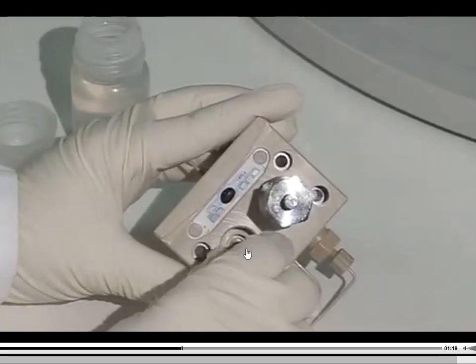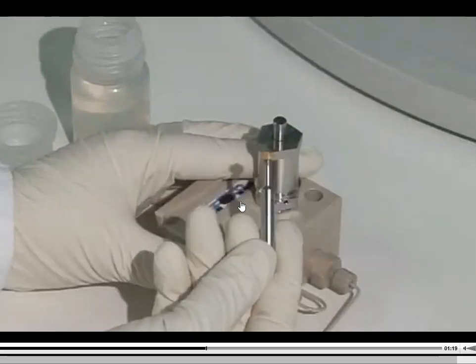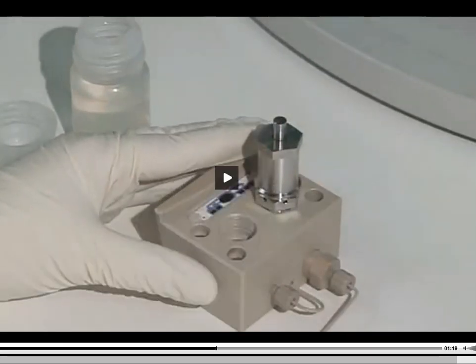So that tool gets basically screwed down into where the seal is at, and you just pop it out of there. And right there is your seal at the end of that tube, and we're going to trash that one. We're going to throw it away, and now we're going to go get a new seal that we can put down on the inside of that pump.